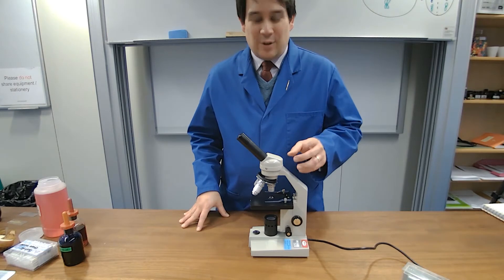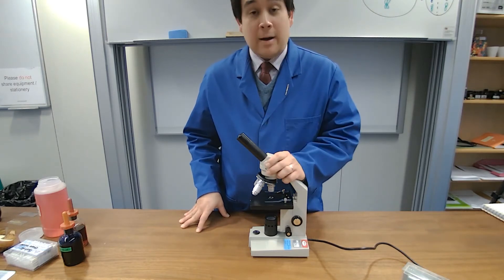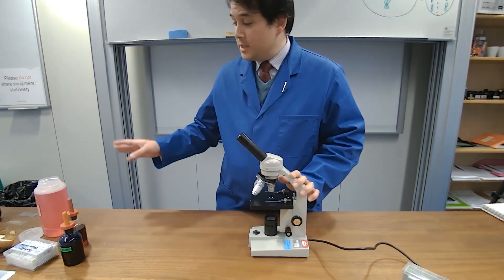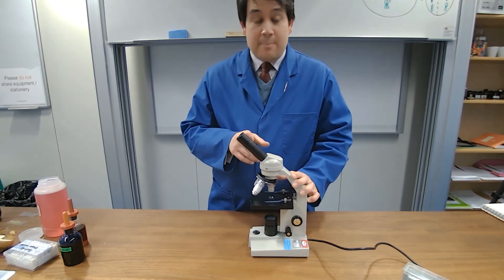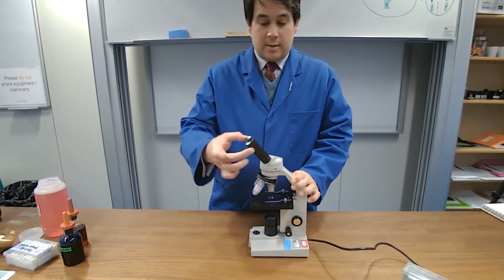So let's have a look first of all at our light microscope which we'll be using to look at our specimens today. We have the eyepiece lens at the very top, this section there.